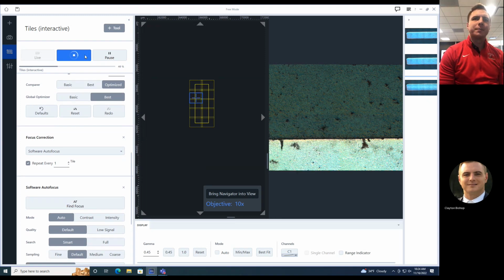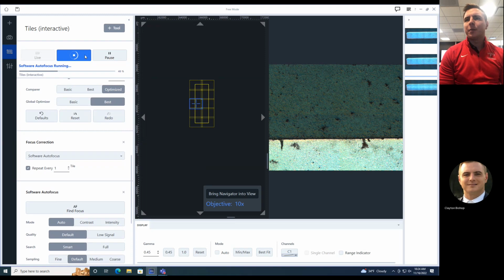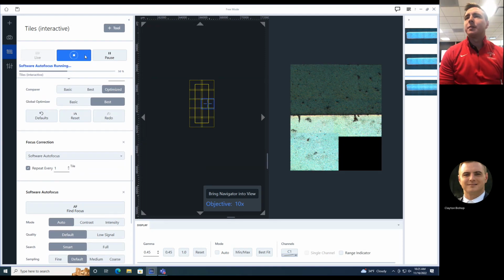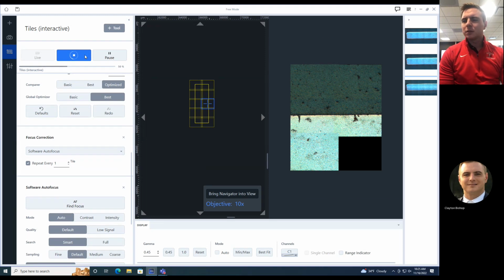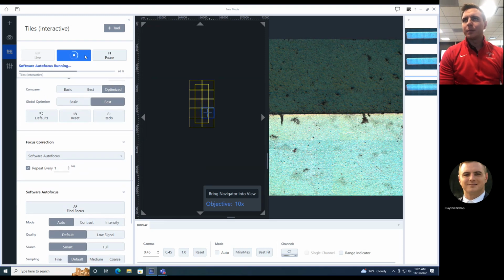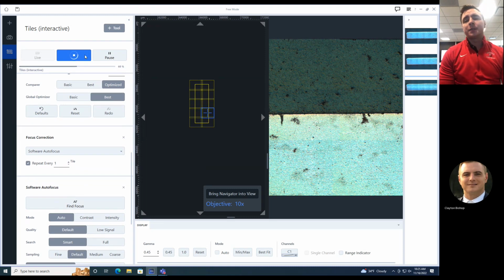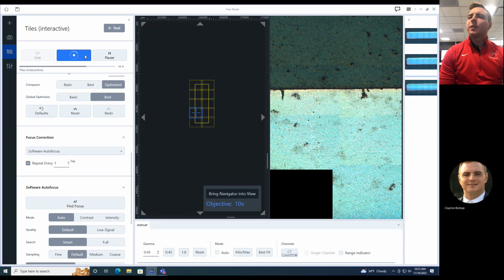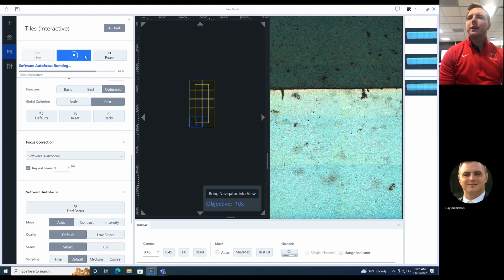It will appear sharper. There we go, about halfway done with this one. And we are moving in Z, finding the right spot, and moving to the next XY position. So it all appears sharp. After this is done, we'll take it into image processing, run a shading correction if necessary. This is utilizing X, Y, and Z all together.